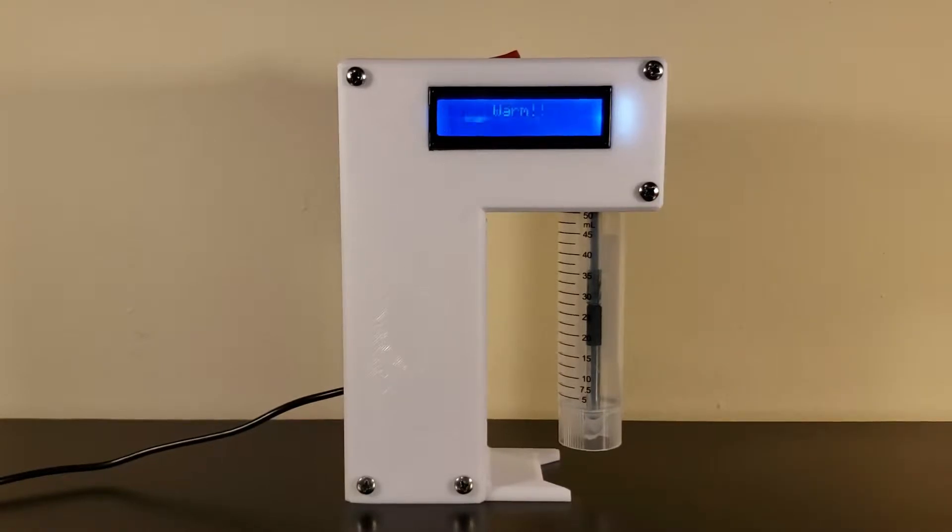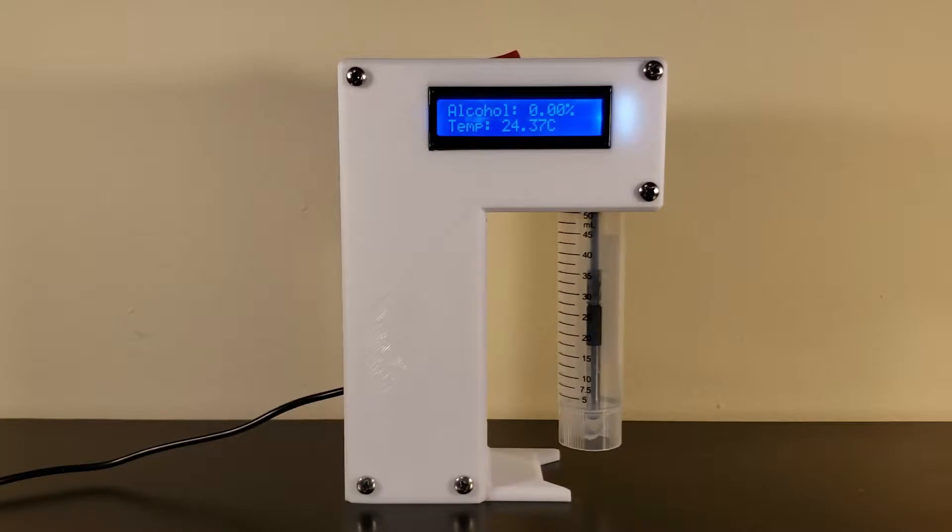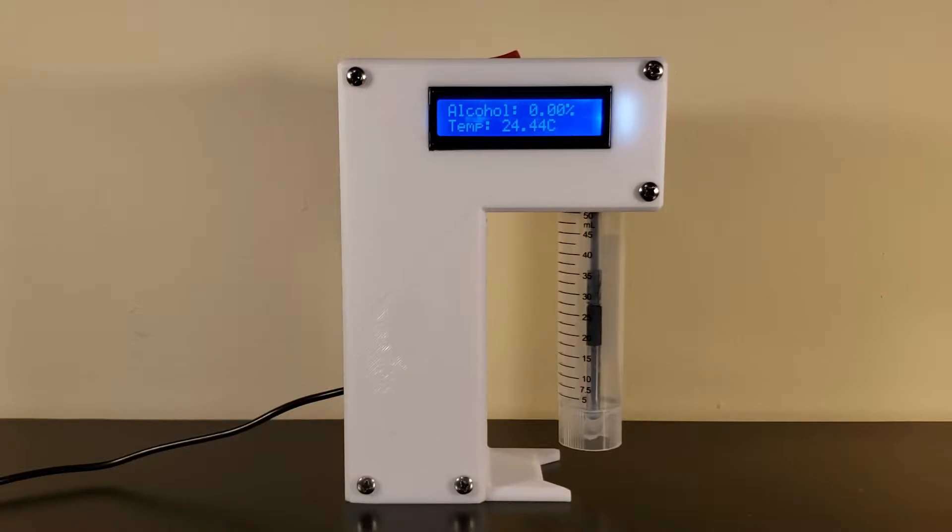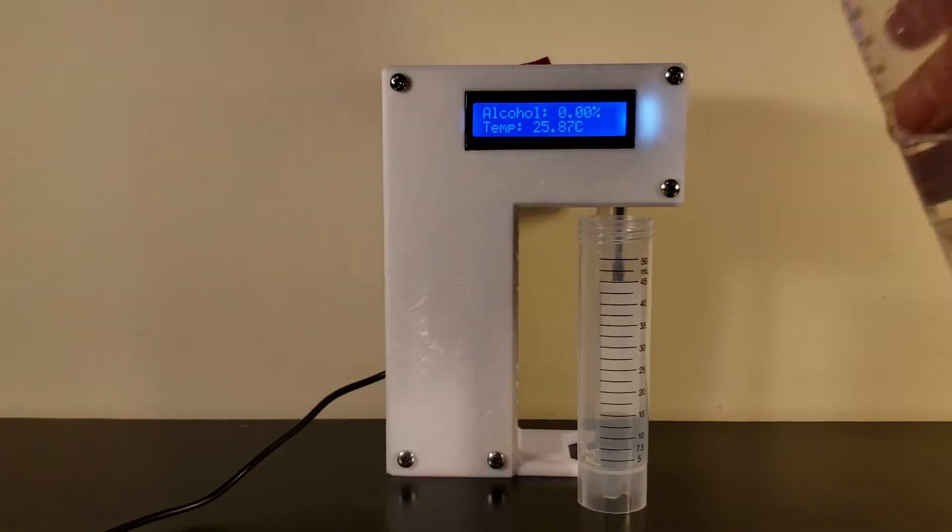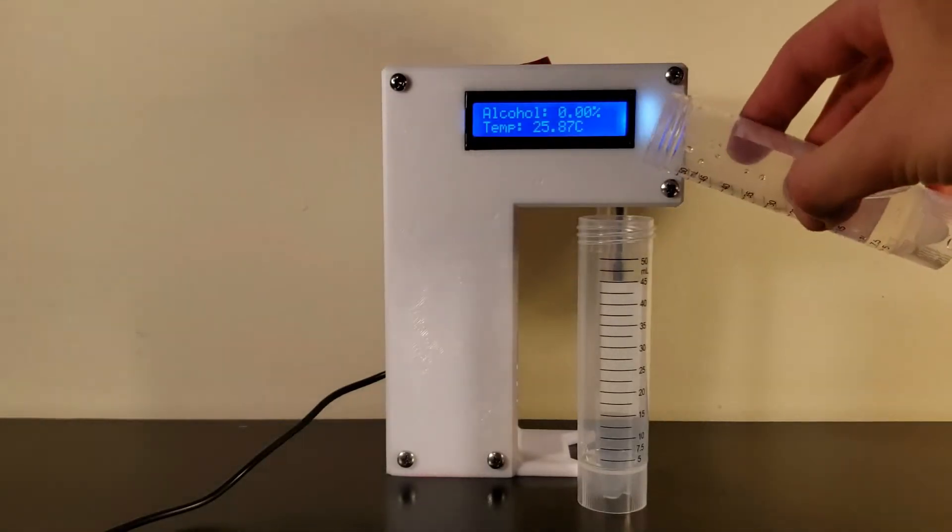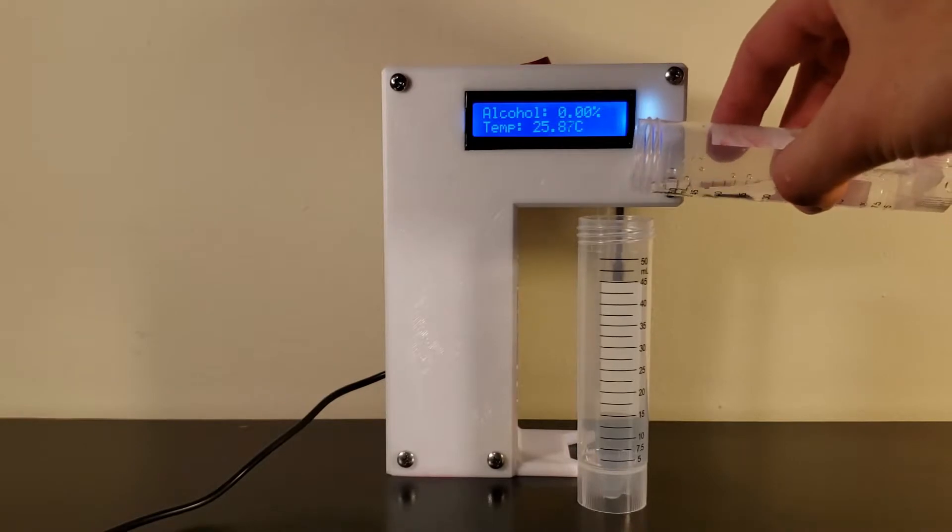Now that the detector is warmed up, the screen will display the alcohol percentage and the temperature of the sample. It is advised to do each sample in duplicate to reduce the chance of reading errors. To prepare samples, add 10 to 20 milliliters of your sample to a tube.